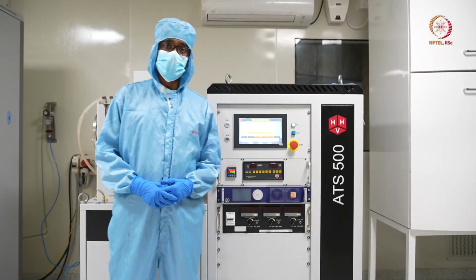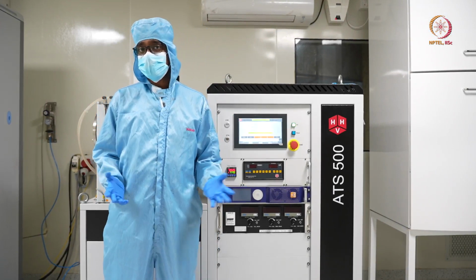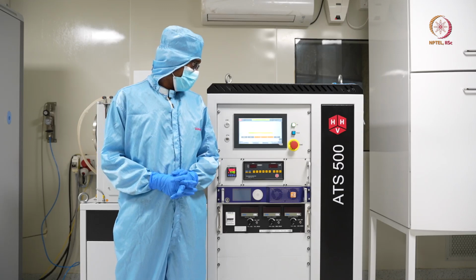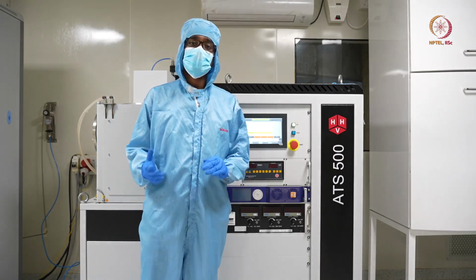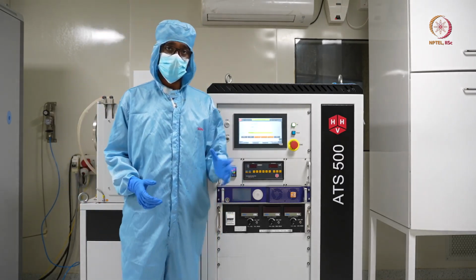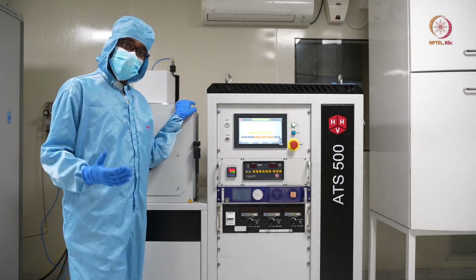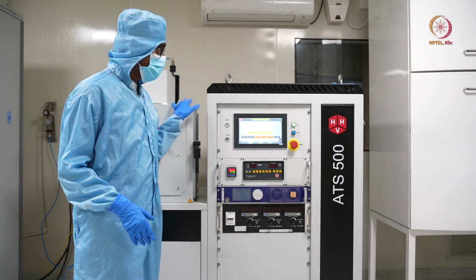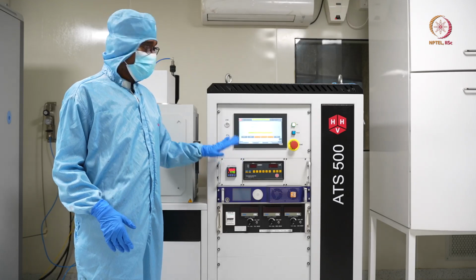So we are here after the break. As you can see here already, the pressure inside the chamber is around 2.78 × 10^-6, as shown here. As we saw in the zoomed-in view earlier, from there you know that the pressure gauge will show the pressure inside the chamber, and that is measured by the Penning gauge installed at the backside of this.